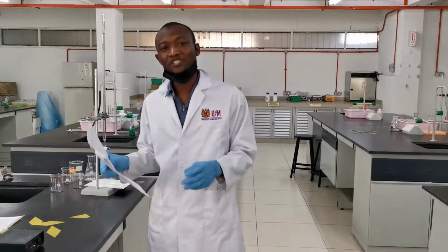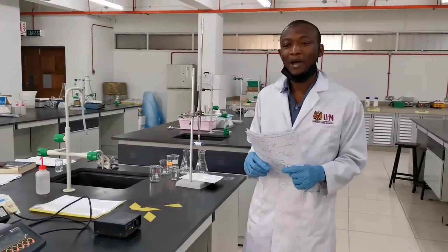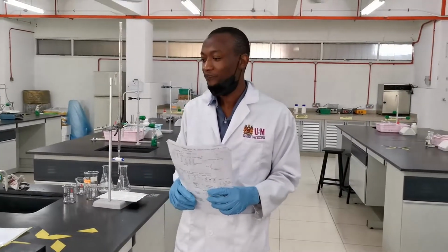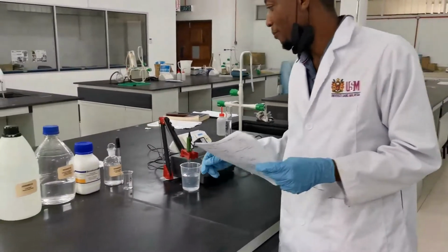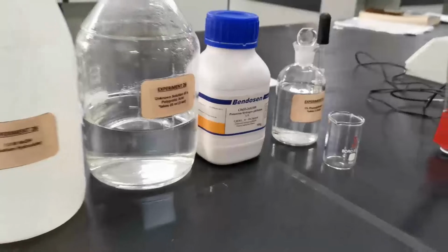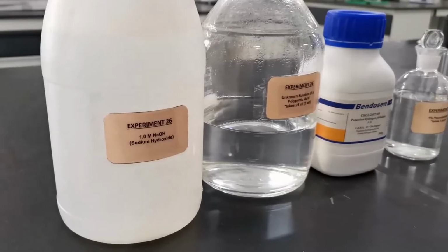I proceed with the experiment. I will introduce you to the apparatus and chemicals that will be used for this experiment. We have here the potassium hydrogen phthalate. We have the sodium hydroxide.